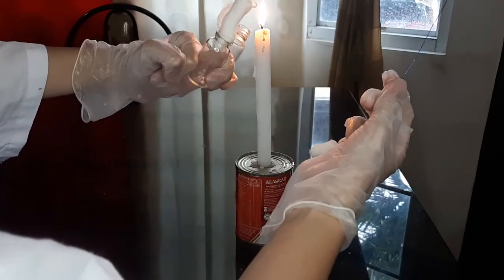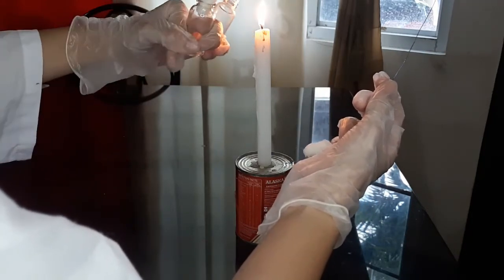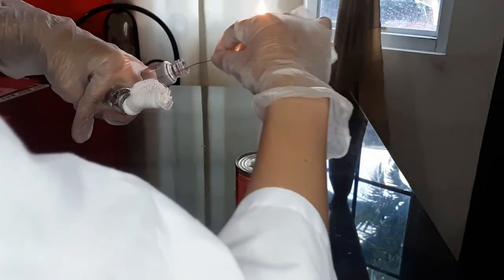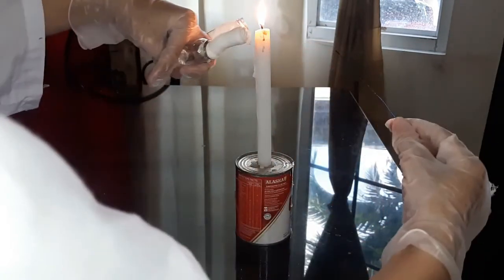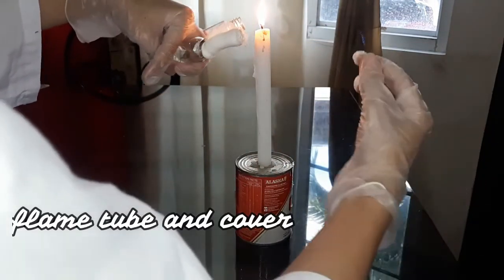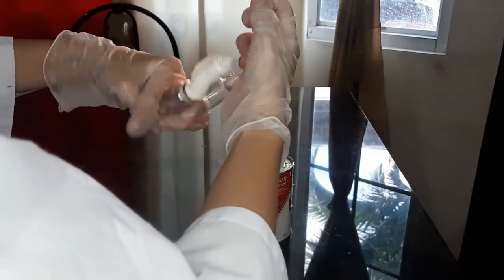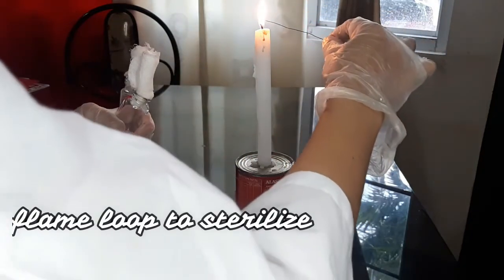Next is to open the second test tube and flame it. Dip the loop once more, flame the tube and cover. For sterilization, flame the loop.